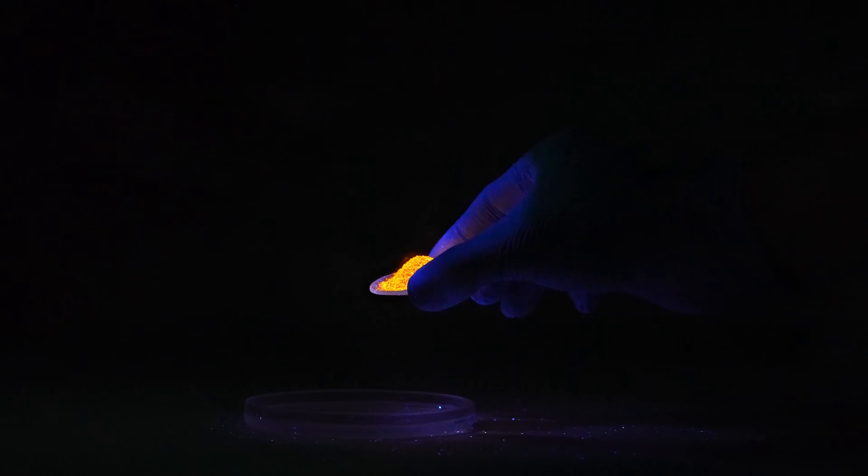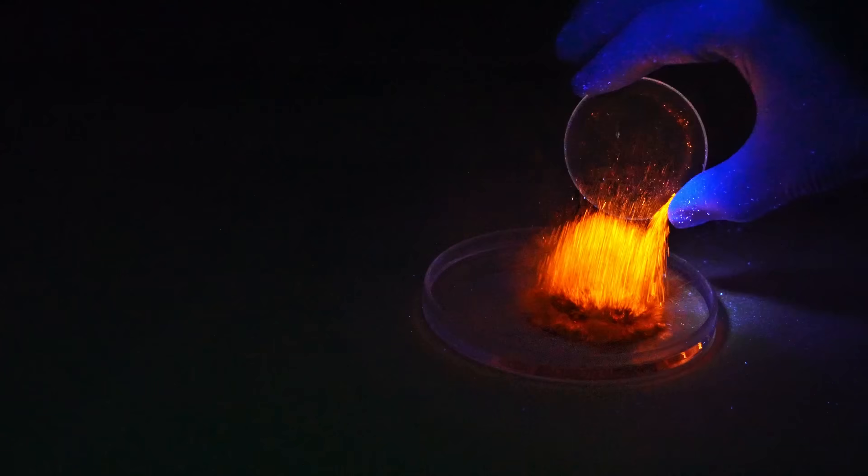Here is how the fluorescence of magnesium nitride fades when it reacts with hydrochloric acid.